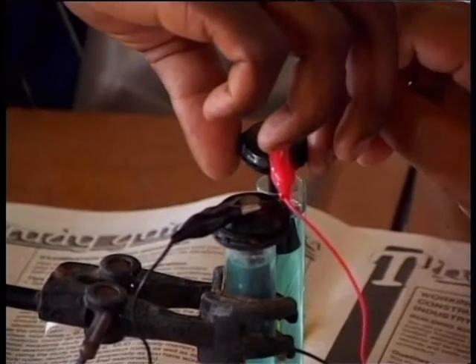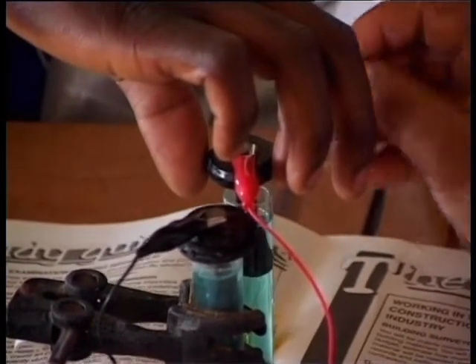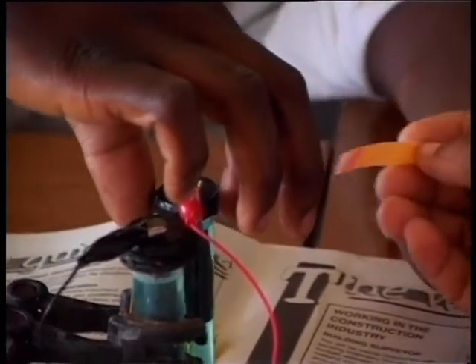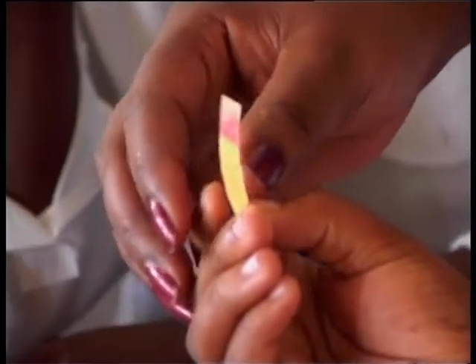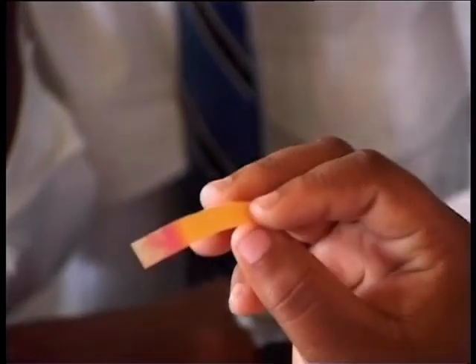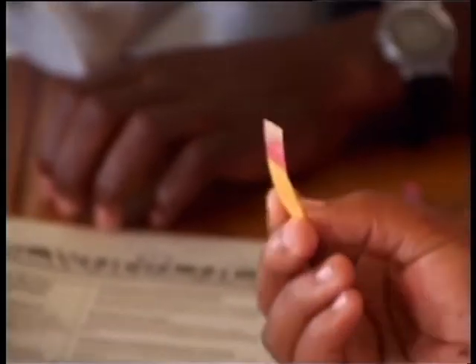Mrs. Makapela spends time with each group of students and their experiments. She goes through the experiments with the students, probing their understanding of the experiments. She asks all the students what the different aspects mean. Really, we can see that it was yellow and it's turning white. So really, that is chlorine. It's a bleaching agent. Ne?